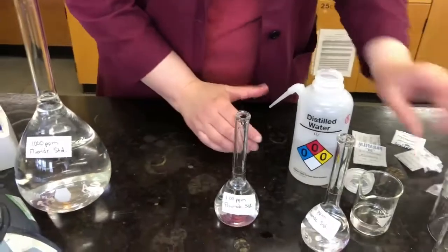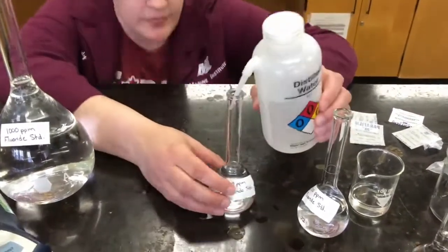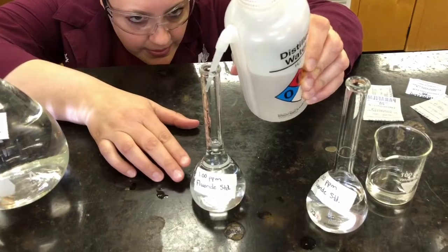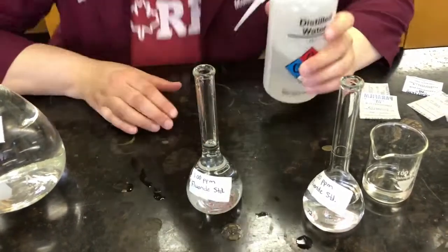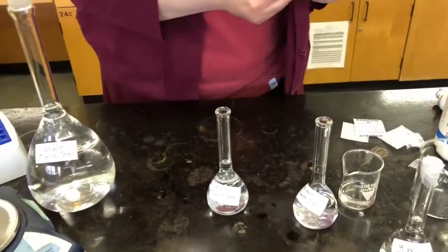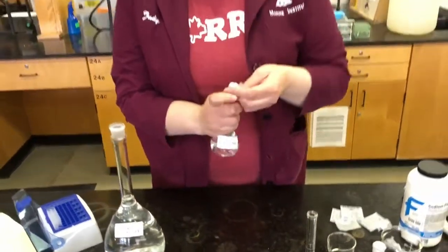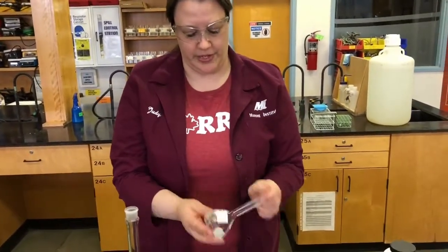Okay, come back to my bottle, come back to eye level. I want to get rid of any bubbles on the side because that can affect my viewing of the meniscus. And there we go, all right, the meniscus. And the more you do this, the better you'll get at getting right on the line for that meniscus. I'll seal it again with some parafilm so I can mix it. You want to do this with all of your standards.